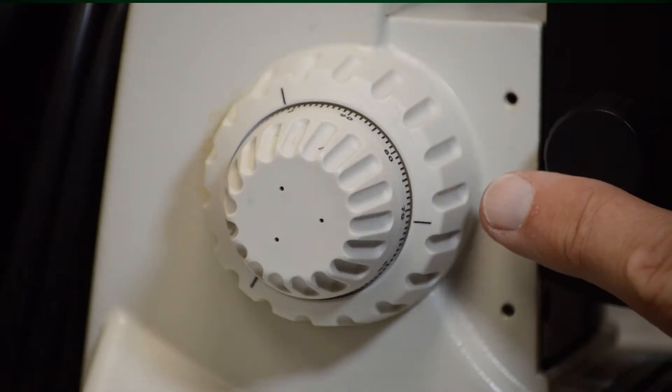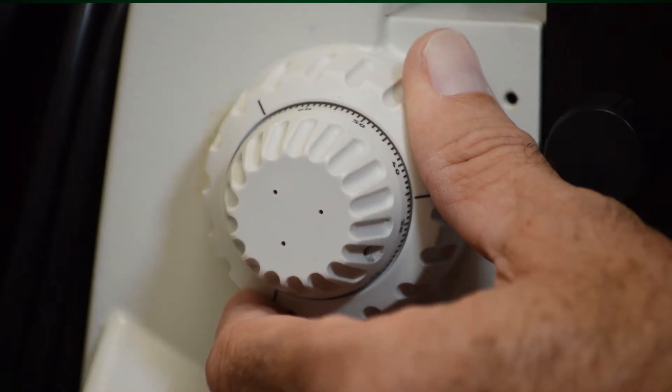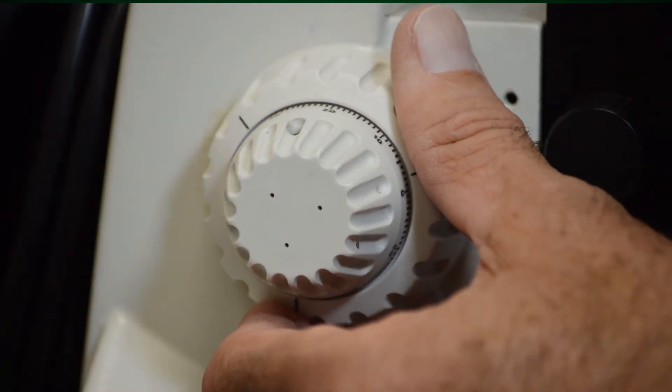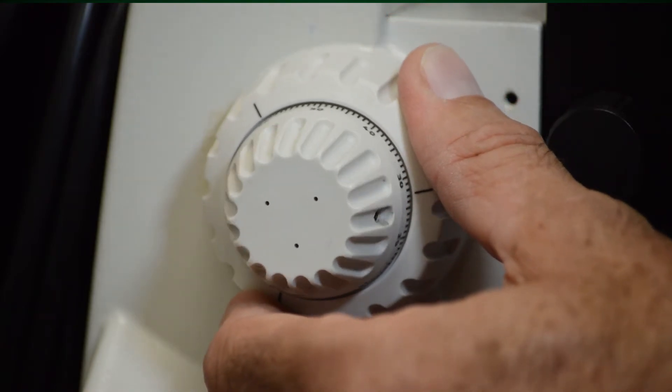You use the coarse focusing knob to get it into a coarse focus and the fine focusing knob to get it into fine focus.